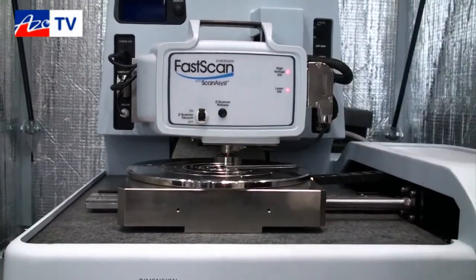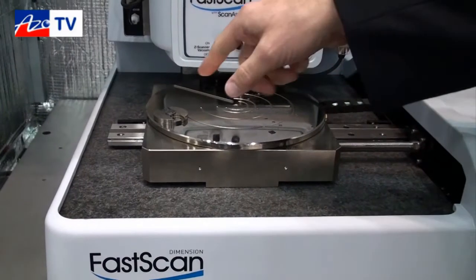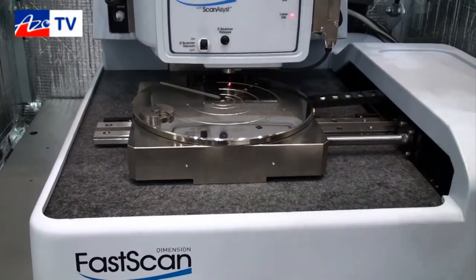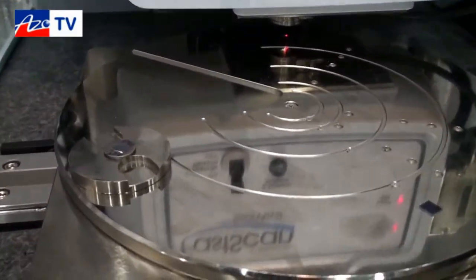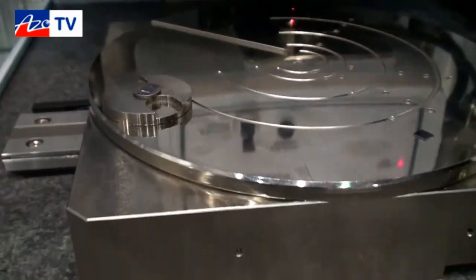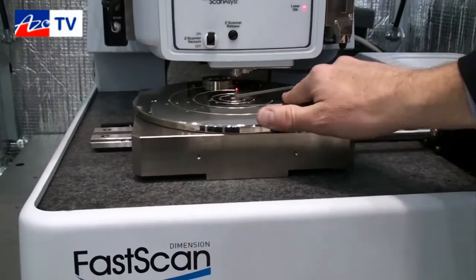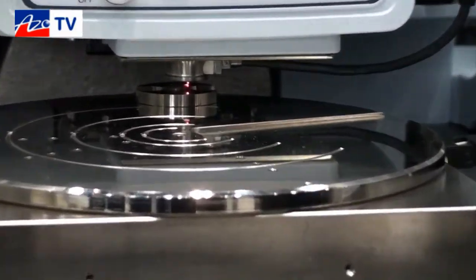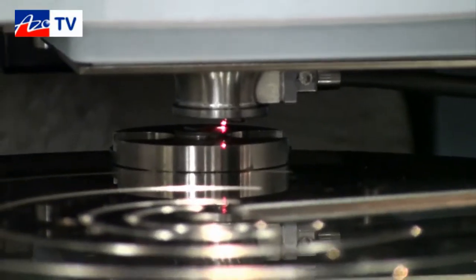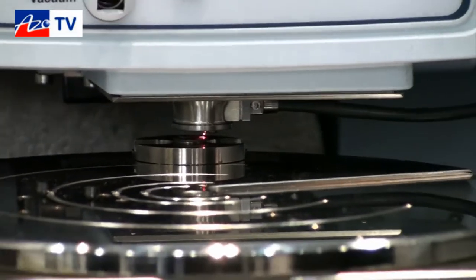The Icon has a 300mm chuck. You can hold the samples down either by vacuum or with a magnet, in this case because I have it on a little metal sample puck. Once you have it on here, you can move the stage around through a lot of that range in order to determine where you want to land. The scanner is basically a flexure design with piezo stacks inside of it. It has a very high resonant frequency that allows you to scan at much higher scan rates without sending the scanner into resonance.